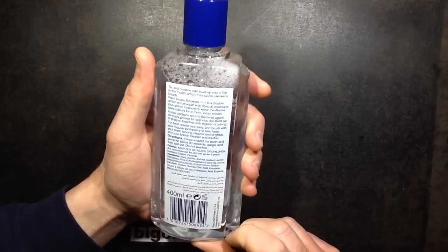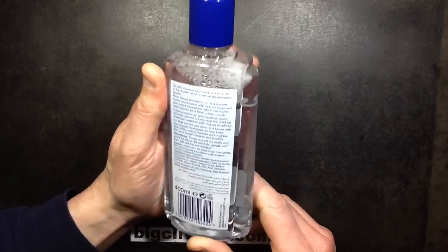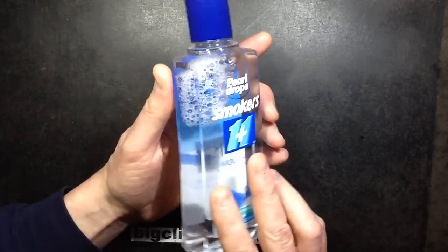Because mouthwash is based on usually ethanol, water, and the various chemical flavourants and things like that.